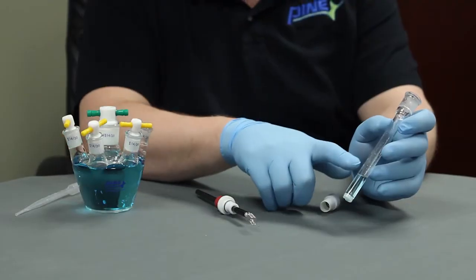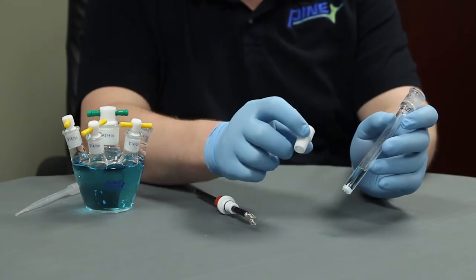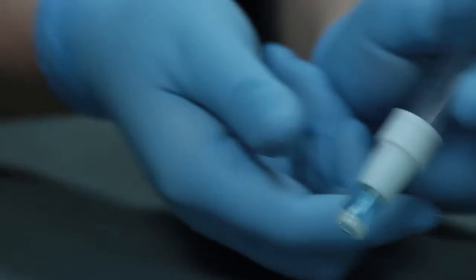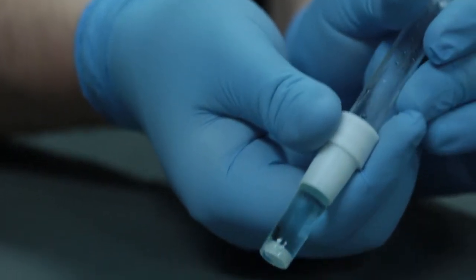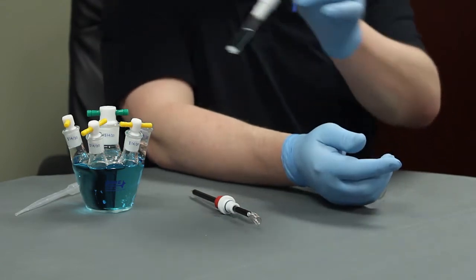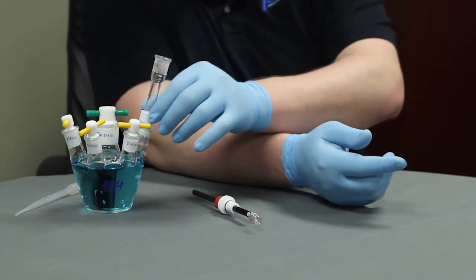After you have solution in the glass fritted tube, take the outer Teflon adapter and carefully slide onto the glass tube. Then, because you'll need both hands, you can place the glass tube into a 1420 port of your cell.